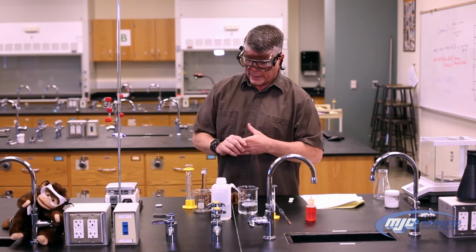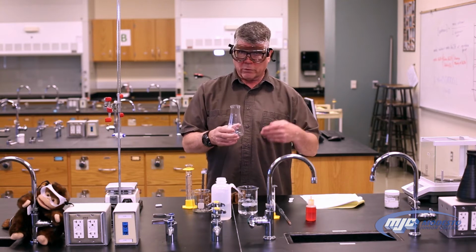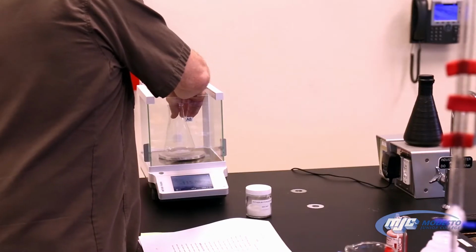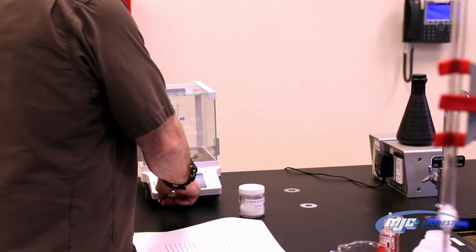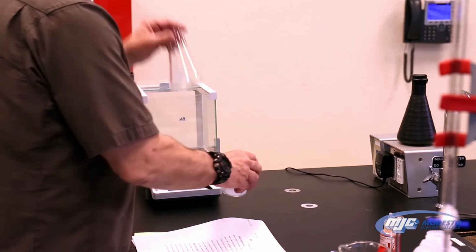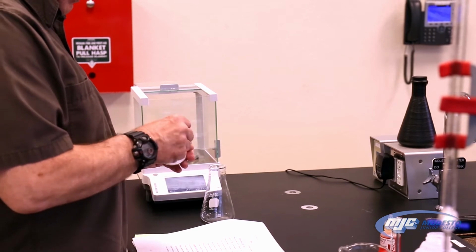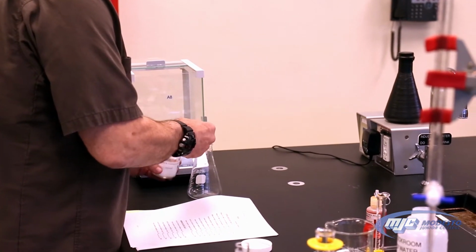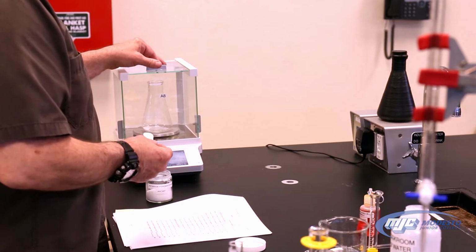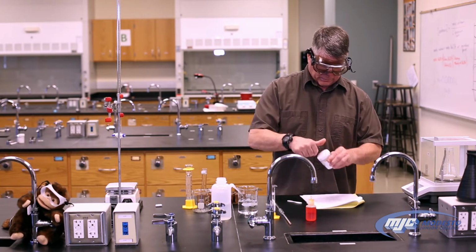The next thing we have to do is weigh out our KHP into our Erlenmeyer flasks. There's going to be 3 Erlenmeyer flasks. We're going to do this part 3 times. We're going to take an empty Erlenmeyer flask, put it on the balance, tare the balance, because we don't care how much the flask weighs by itself. Take it out because we never add anything directly on the balance. And we're going to put somewhere between 1 and 1.2 grams of KHP in there. And right, 1.153. Everybody's going to have a different number. You'll get your own numbers for that. That's going to be my A1.